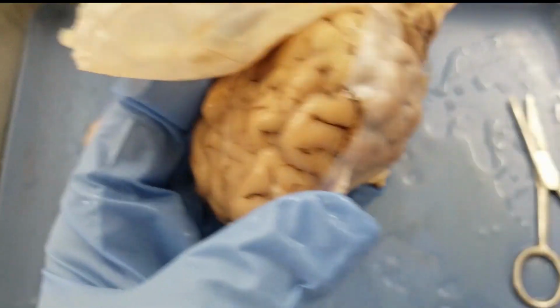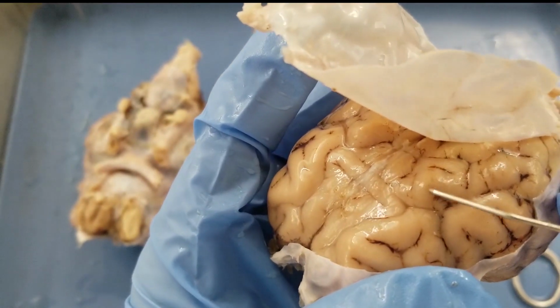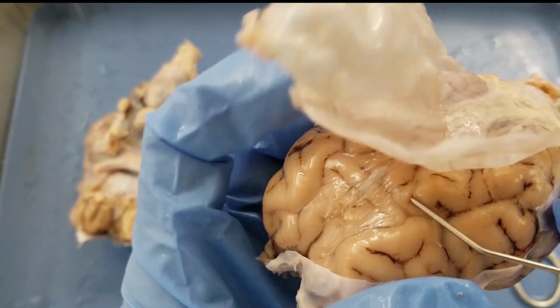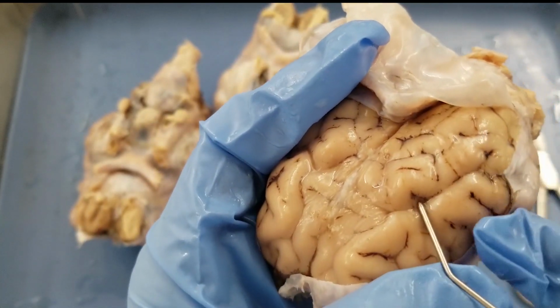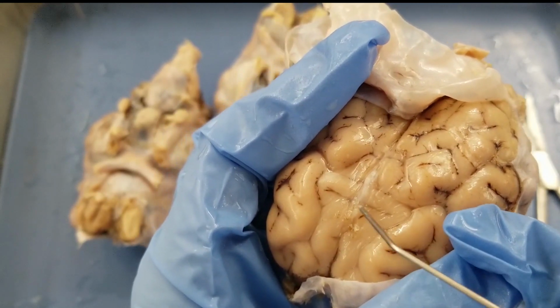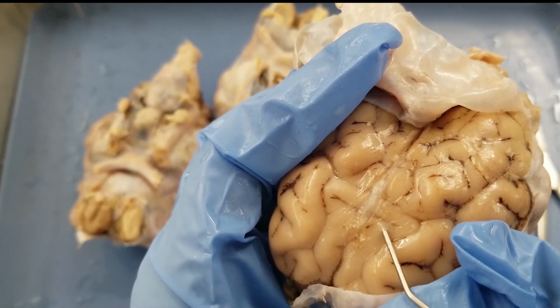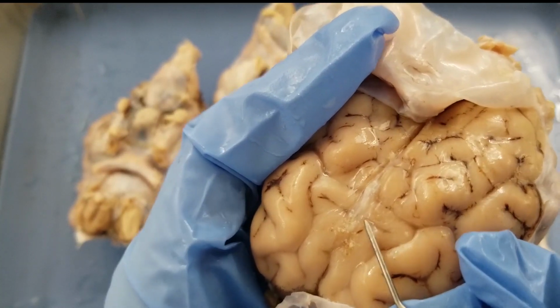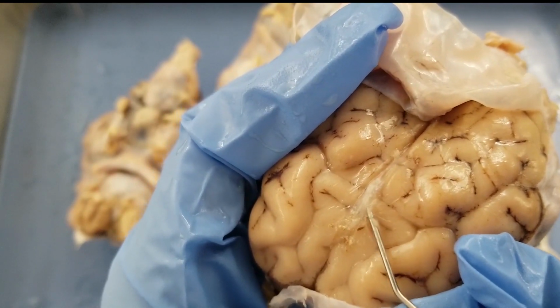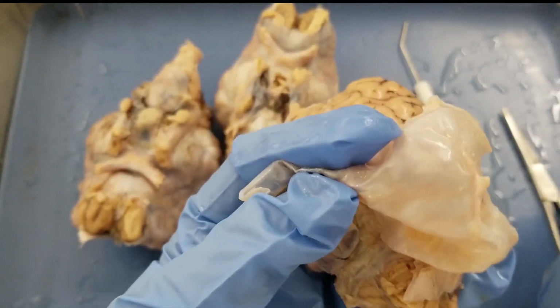There are very, very thin membranes lying on the brain. That's where, let me see if I can poke it. Oh, that's very, very thin. I'm going to see there are shiny structures. That's the arachnoid and dura and the pia mater. I'm going to poke the brain. See here. Okay, that is the arachnoid and pia. Okay, I'm going to continue cutting.